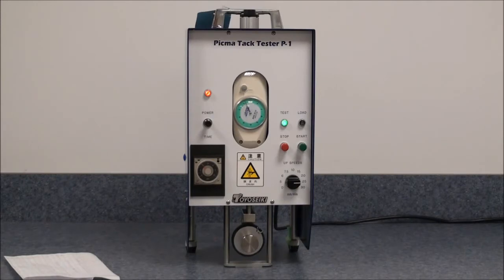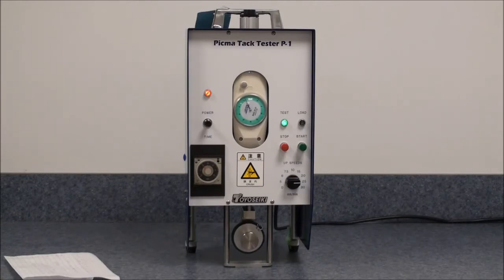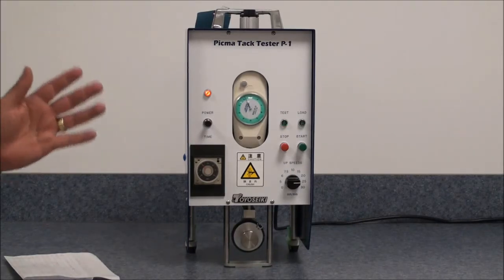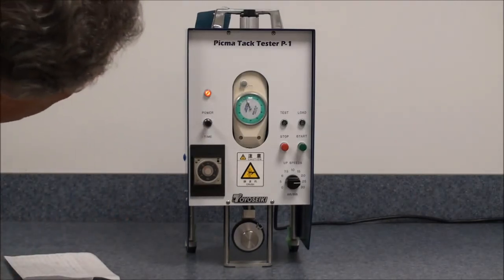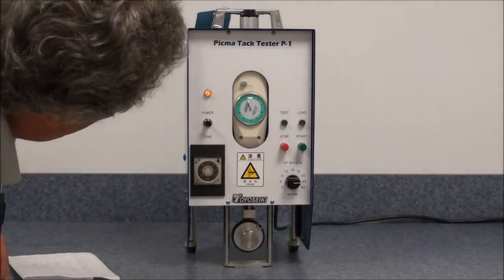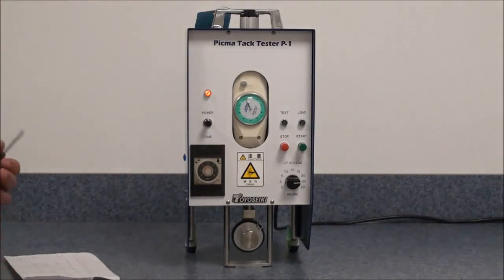Your test is now complete and you can take the reading off the dial indicator. And as we see here, it is 2.8 N.